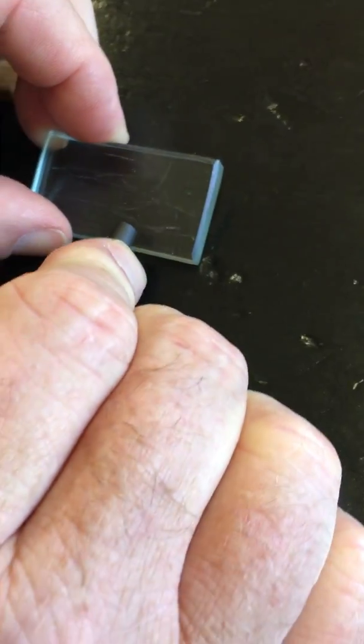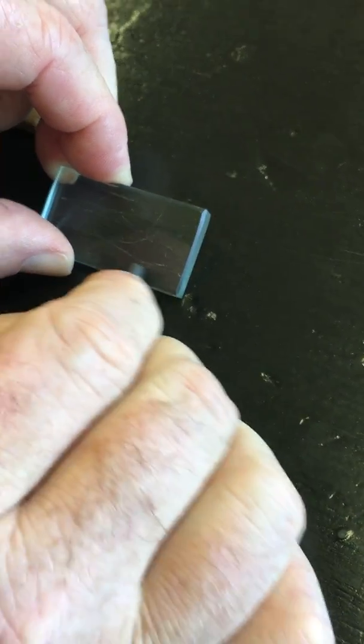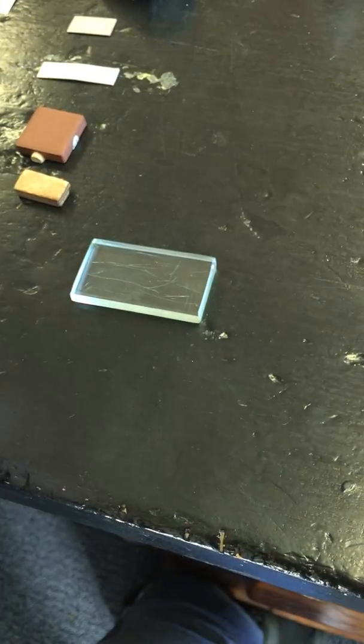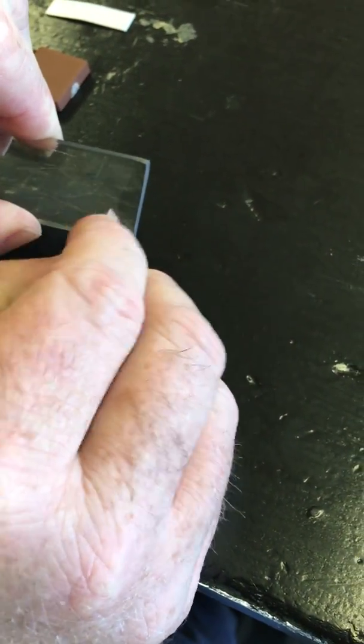Carbon, and again, you've got to find a spot. Okay, so I scratched it. There's nothing there. Okay, so if it doesn't scratch, it has to be softer. If it does scratch, it is harder. Your piece of copper. Okay, again, looking down here, there is nothing there.